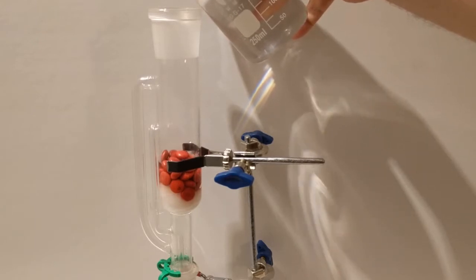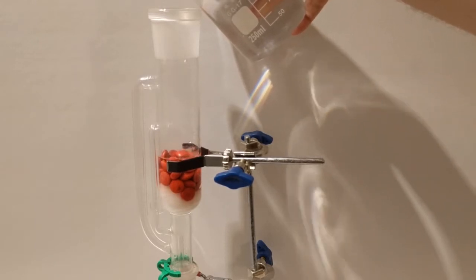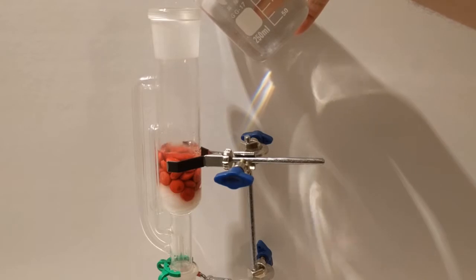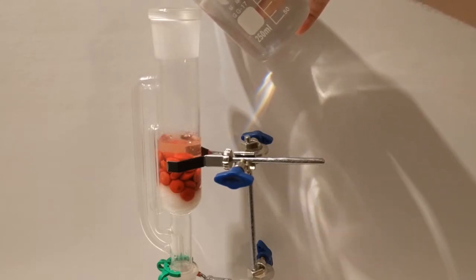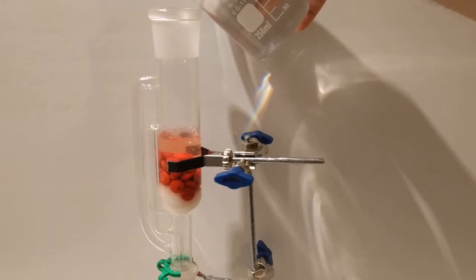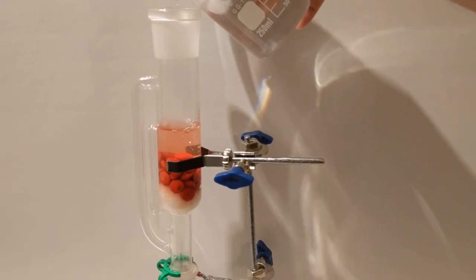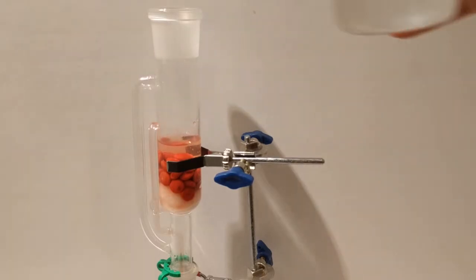But in this case, the weird thing I'm doing is adding the solvent manually. So I'm pouring in water. However, what is working normally, and you'll see it in a moment, is that when the water reaches a certain height, it starts getting siphoned off. And there it goes. You can see the small tube on the side going all the way down. It's sucking down all of the water into a collection flask on the bottom.